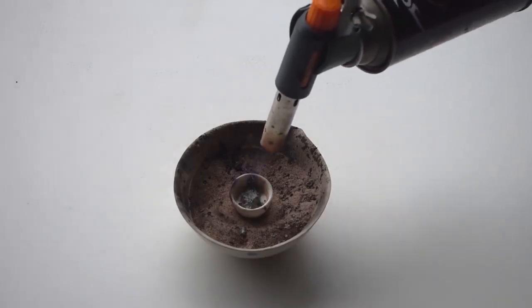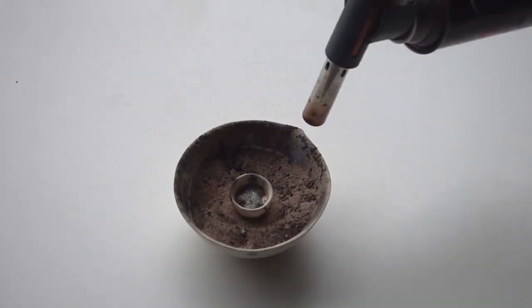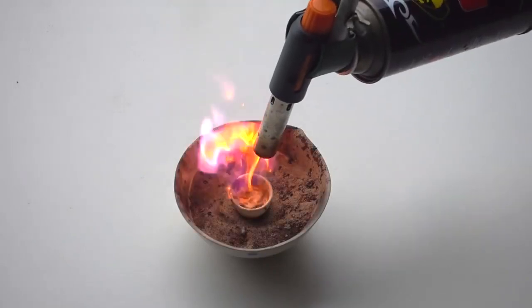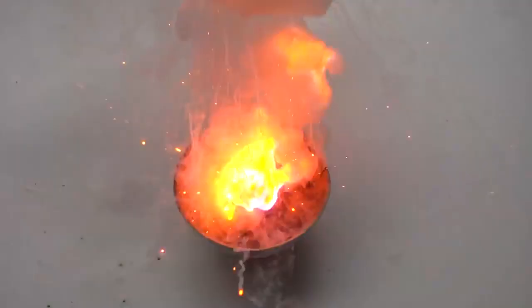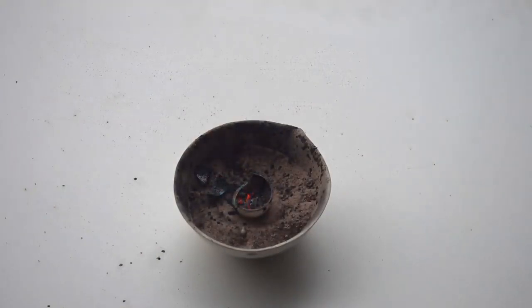Next, I decided to learn how cesium reacts with manganese sulfate. The response wasn't very rough, but it was better than with sand, when it formed metal manganese.